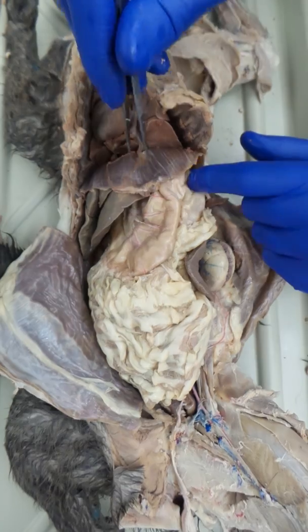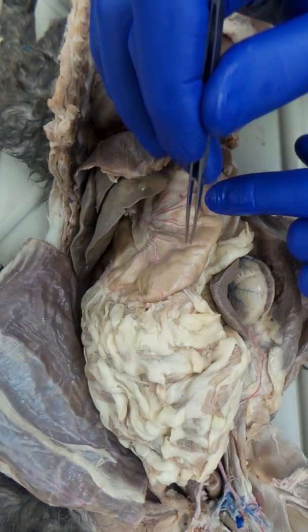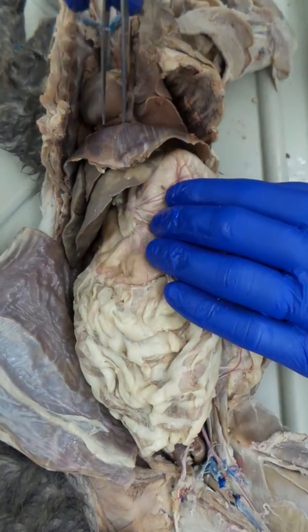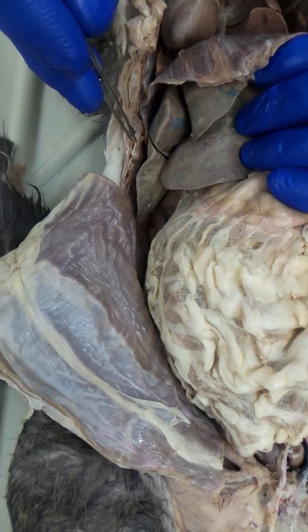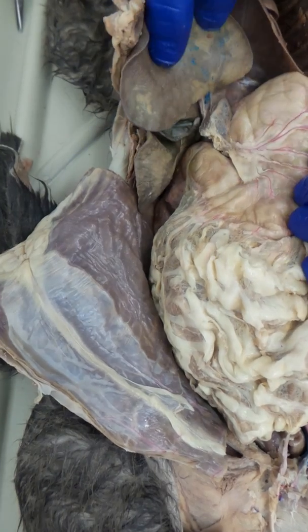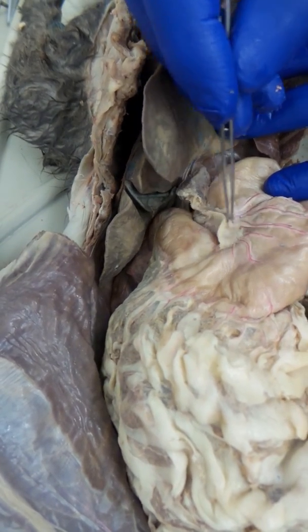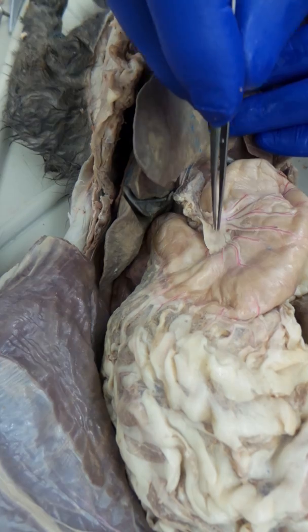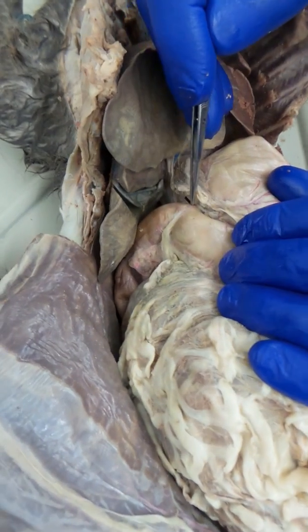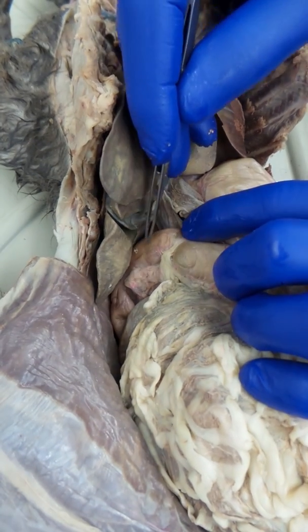Reorienting some of the organs — again we have the diaphragm. This is the stomach, which I will not open, but if it is open you could see gastric rugae. We have the spleen. The greater omentum is all of this fatty-looking stuff. And then you have the liver. There's the gallbladder on the liver. If I lift the liver, you're seeing the stomach a little more. All this little fat running off of the lesser curvature of the stomach is the lesser omentum. So it's stomach, liver, lesser omentum, greater omentum. Working your way around that stomach, you see this little dimple right here that pushes in — that's the pyloric sphincter. That's where the stomach ends and the small intestine, in this case the duodenum, begins.